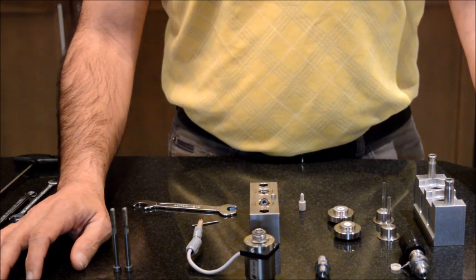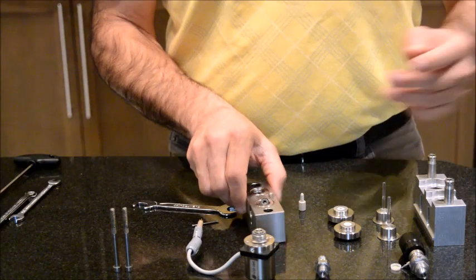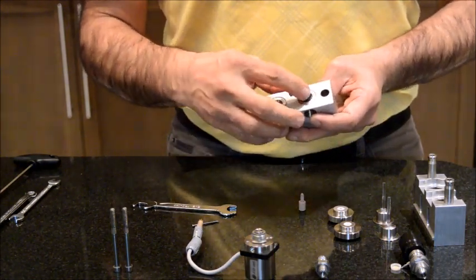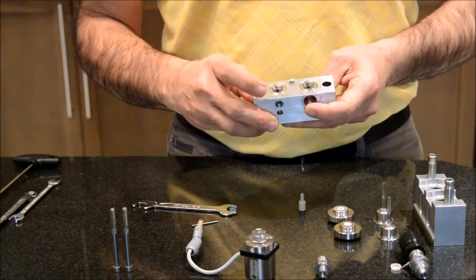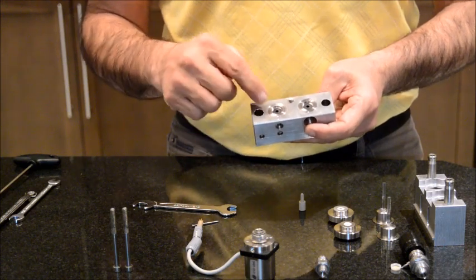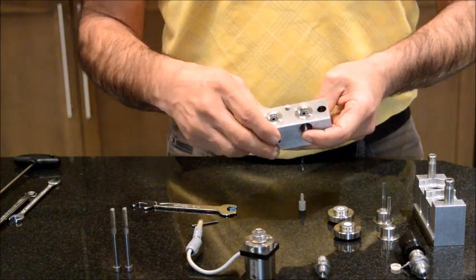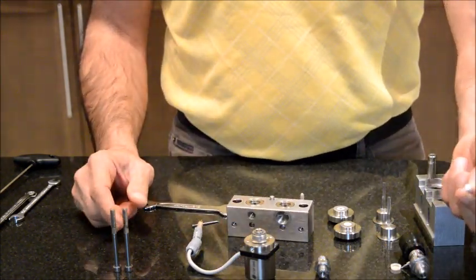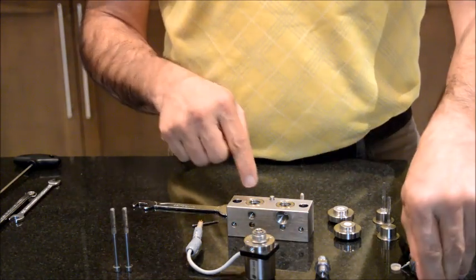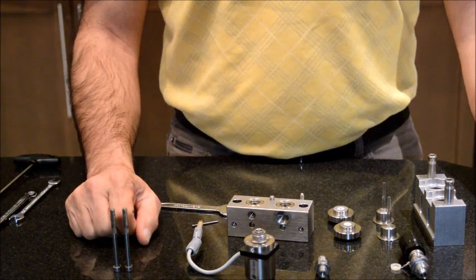Number two that comes to my mind is the use of solvents that are not compatible with your pump. Number one is the use of a high concentration of THF. These pump seals that I'm showing you, the black ones, are not THF compatible. Maybe you use 1%, 2%, 0.5%, whatever the percent THF is, over time it's going to damage these pump seals and they start to disintegrate. When you replace your filter, you realize that your filter is so black, and this dark color is actually coming from the pump seals that start to disintegrate due to the incompatible mobile phase that you use.